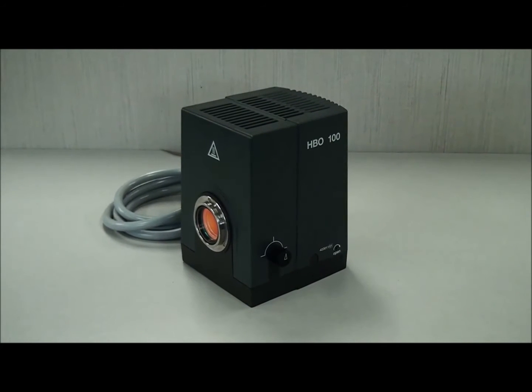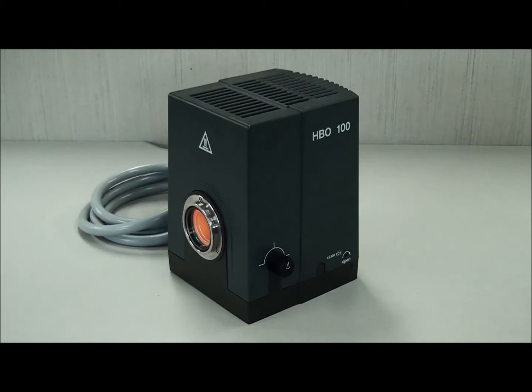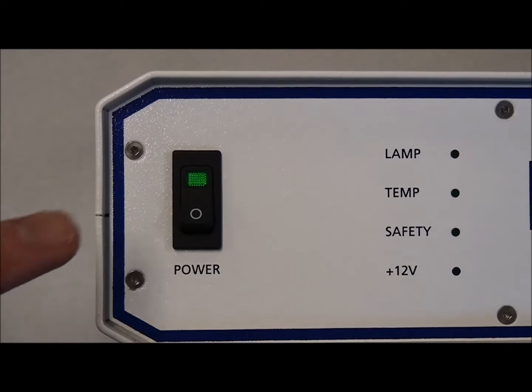This video will go over the removal and replacement of an HBO mercury bulb. Switch off the power supply.